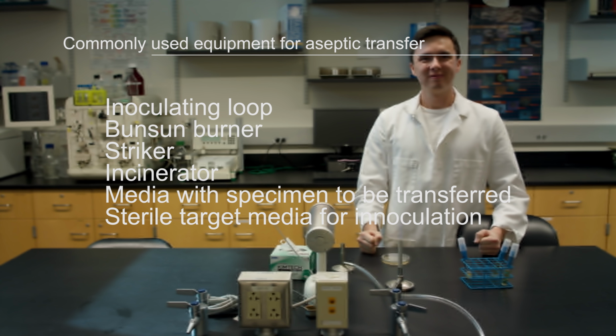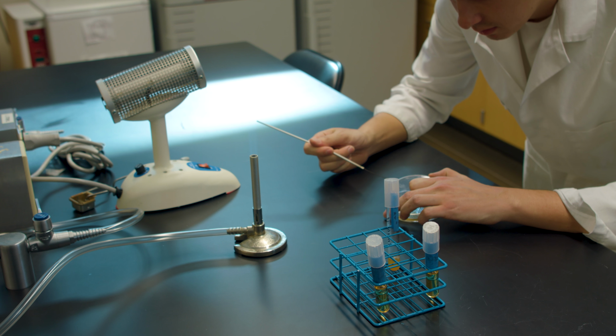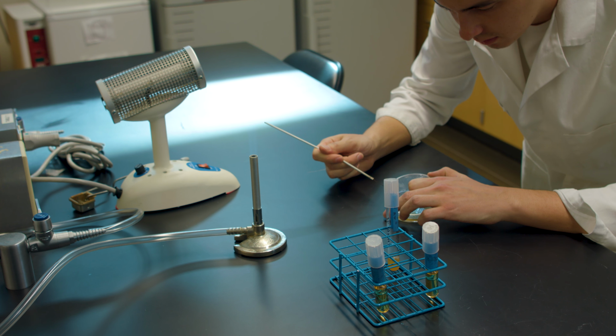Remove the loop and be sure not to touch any other surface as the loop will become contaminated. Allow the loop to cool to room temperature to prevent heat killing of the organisms you want to transfer. First, aseptic technique will be demonstrated when transferring from a TSA plate to a sterile broth.